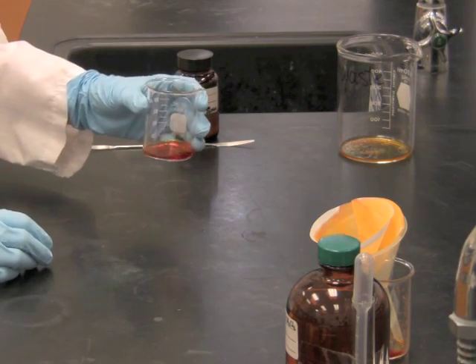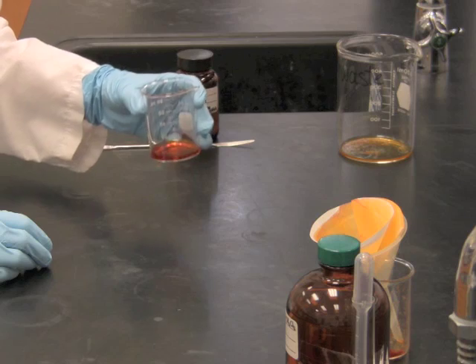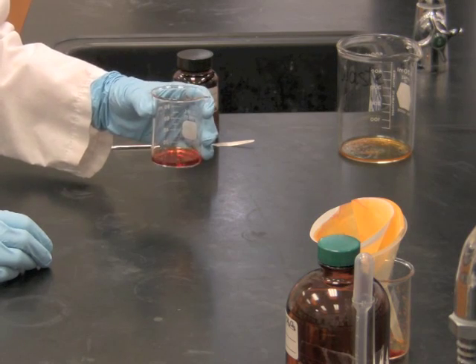I'm going to put it into the hood so that the solvent evaporates and when it's completely dry, we'll reconstitute it.